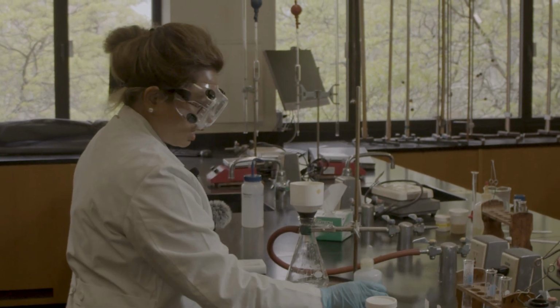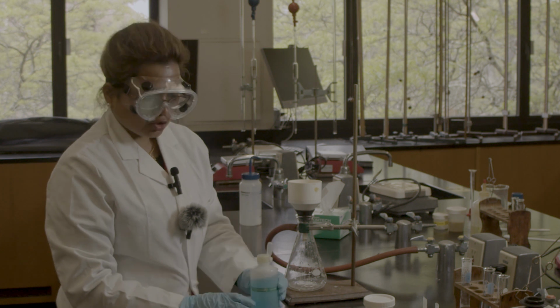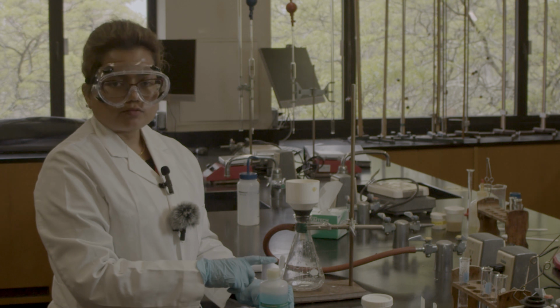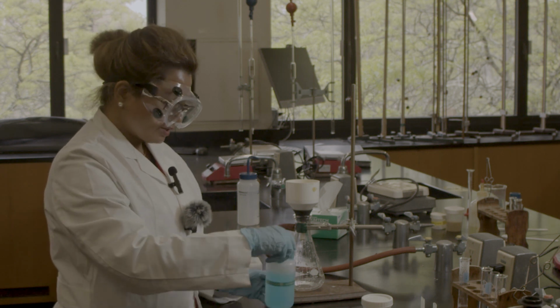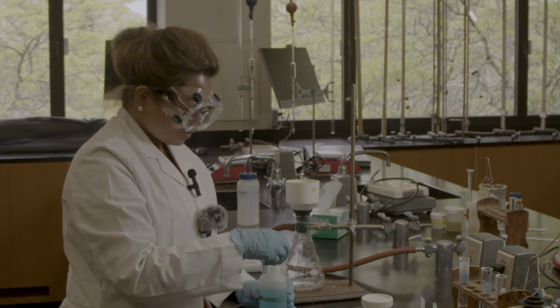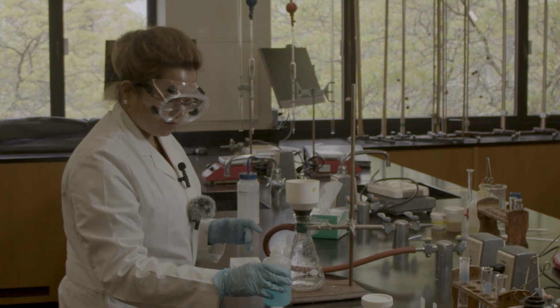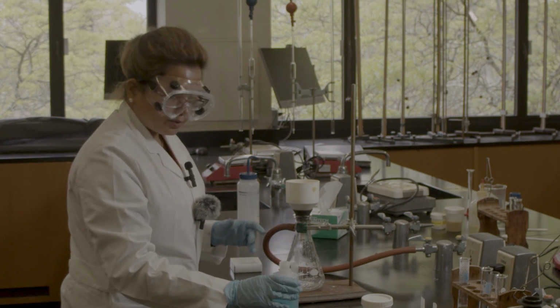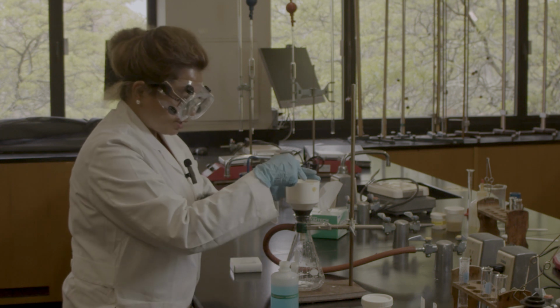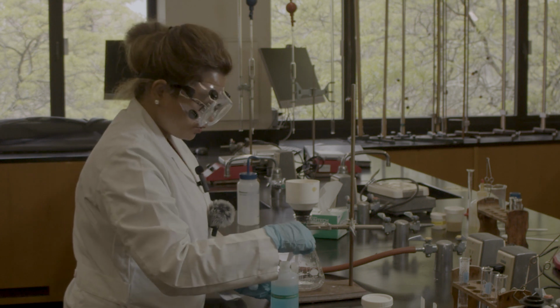Now I want to see, this is called cupric sulfate. This is totally dissolved, you can see. Now I want to see whether this dissolved cupric sulfate will be filtered, so it will stay here, or whether it will go inside. That's what we are going to check.